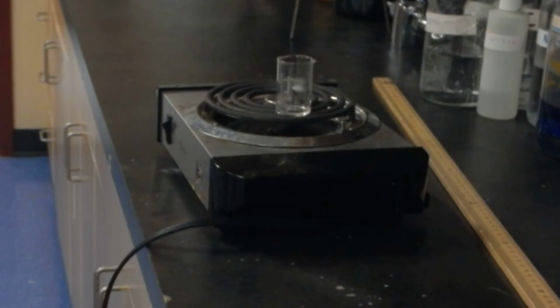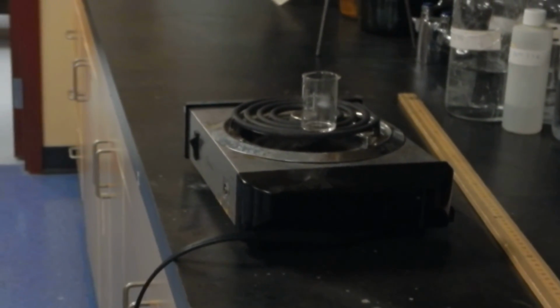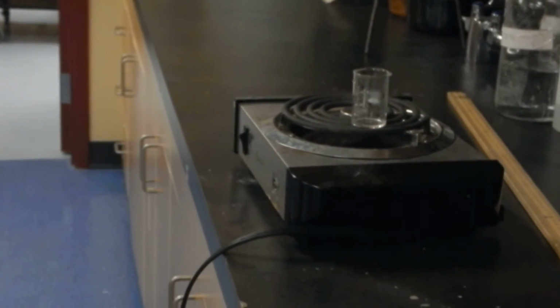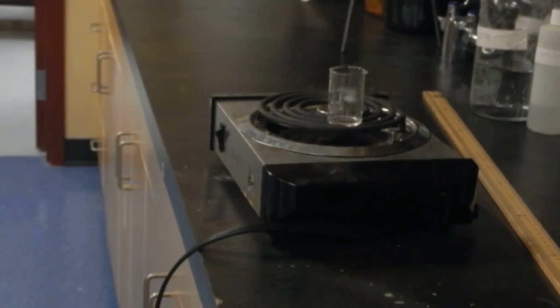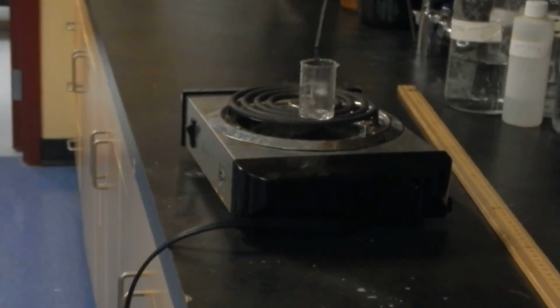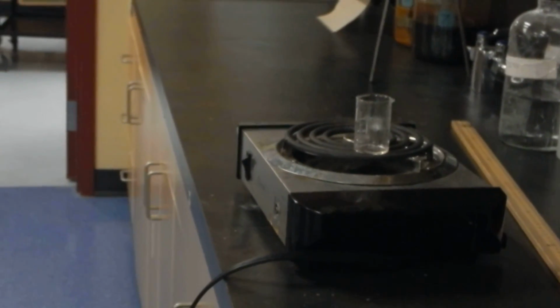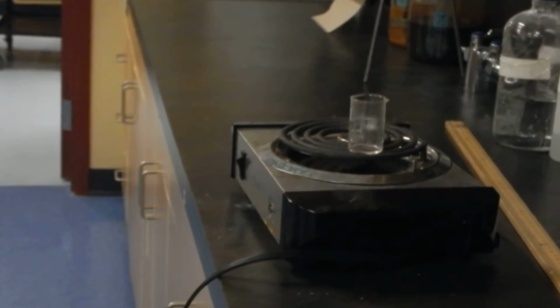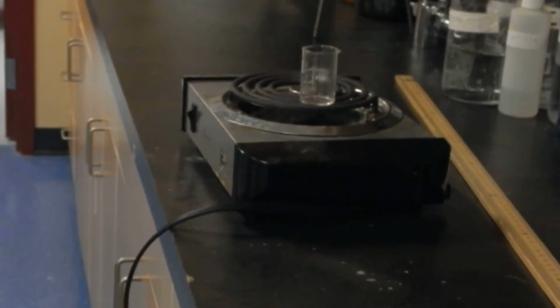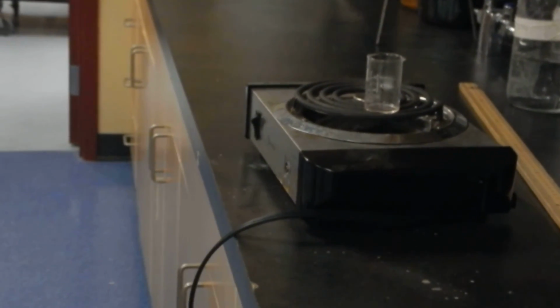Okay, looks like we've hit pay dirt. We're almost there. Beautiful. Like a baby with gas. Fried noodles. And we're starting to see another change. Just about there.